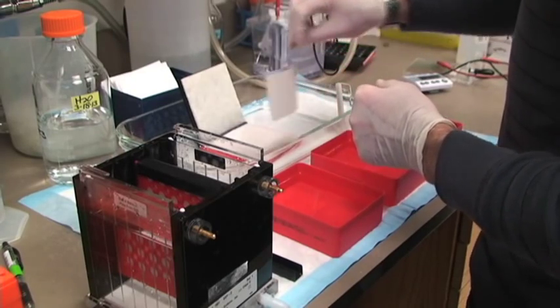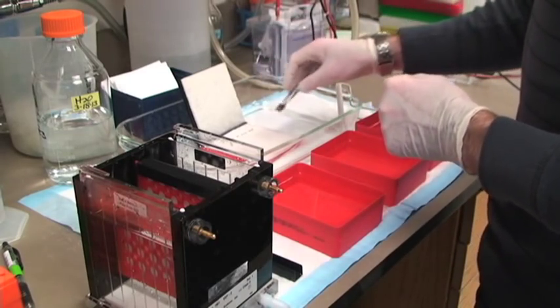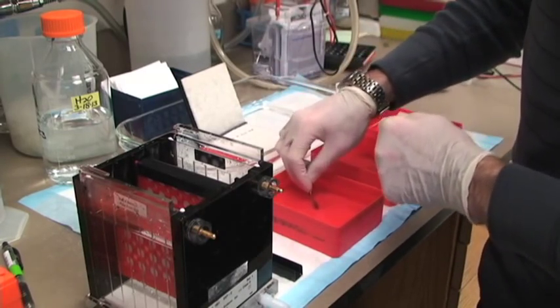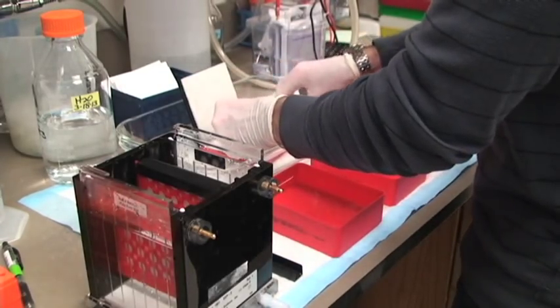Here's your blank membrane. It's always run to red, black to red. There's membrane there. Larry's using the black and red colors to help him orient the cassette in the right direction, negative to positive.